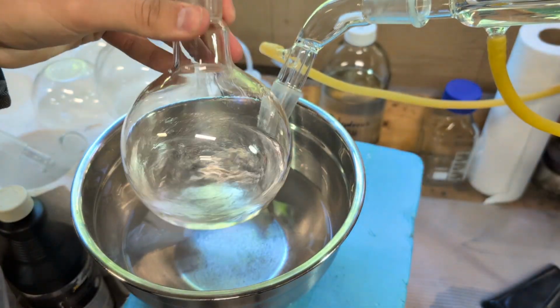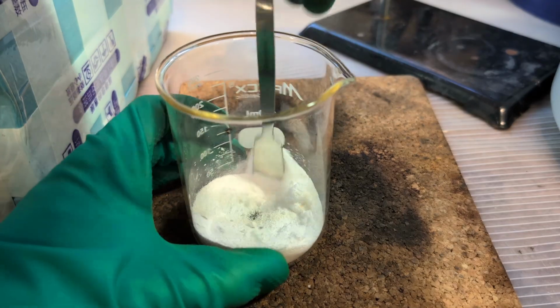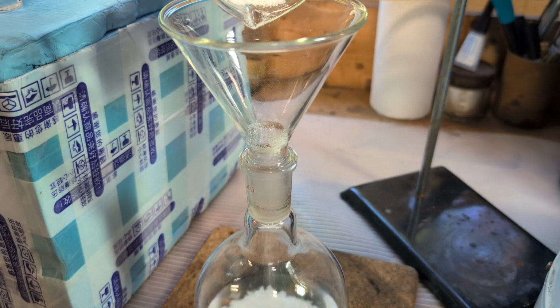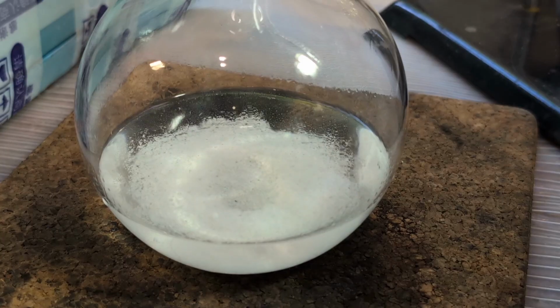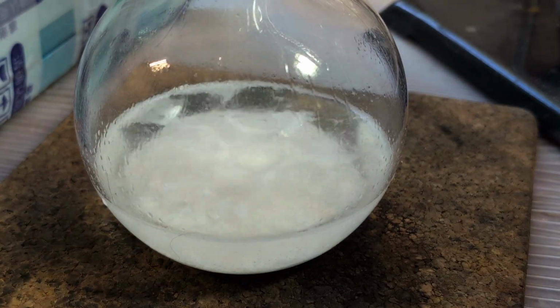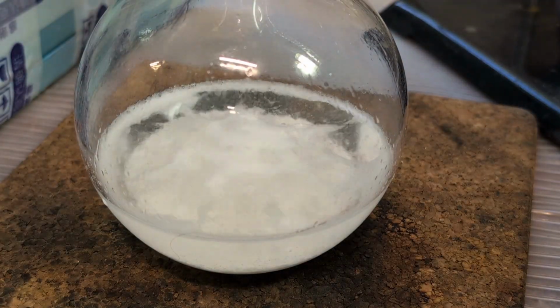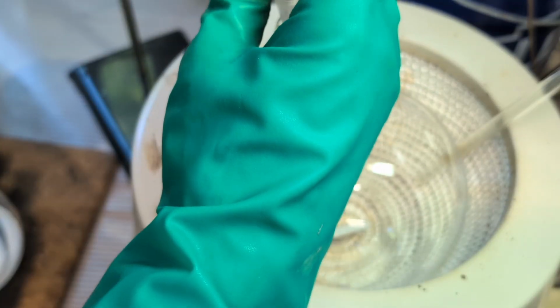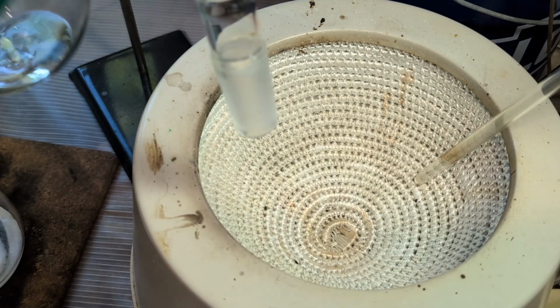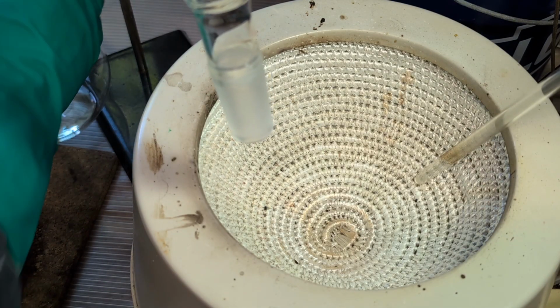Once the second distillation is complete, I break up the anhydrous calcium chloride and add it to the ether. The calcium chloride absorbs any remaining water and residual ethanol. Since this process is strongly exothermic, it can easily boil off some of the ether, so it's best carried out in an ice bath. Ether vapors are extremely flammable and can ignite if they come into contact with a sufficiently hot surface, spark, or open flame.